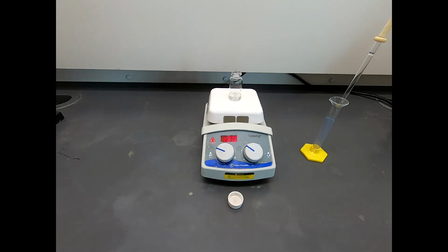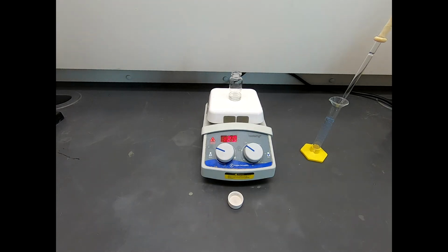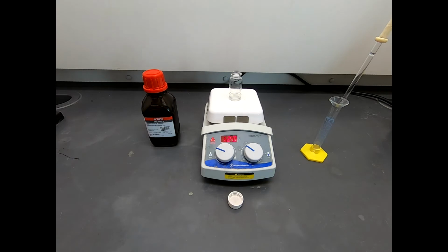And this is hydrazine hydrate. It is 51% hydrazine in concentration. Okay, great. So we have now dispensed our hydrazine reagent. And now, in theory, this is all this needs. So we have our beta ketoester in there. We have our solvent, 1-propanol. We have 3 or so drops of acetic acid as a catalyst. And we have our hydrazine.